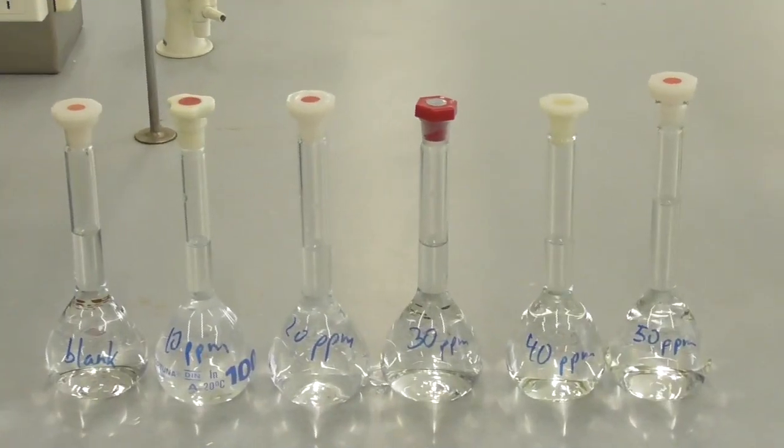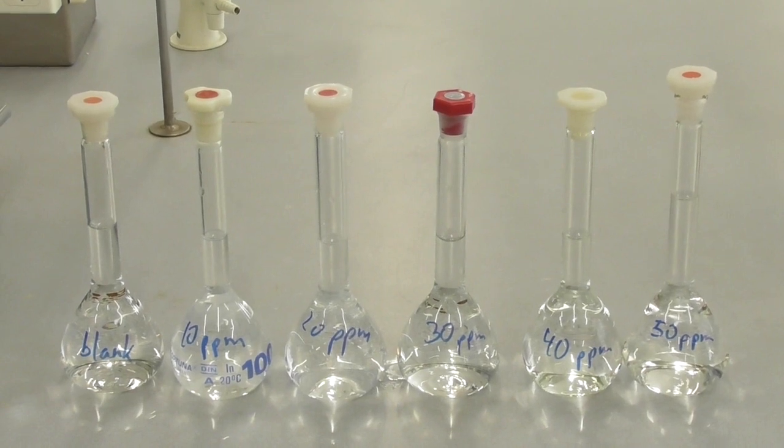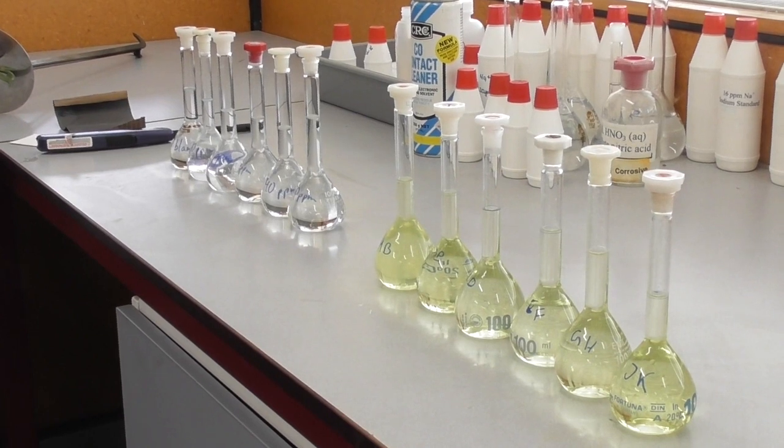This will need to be repeated for all the standards as well as a blank. And then they will be lined up next to our sample solutions at the instrument.